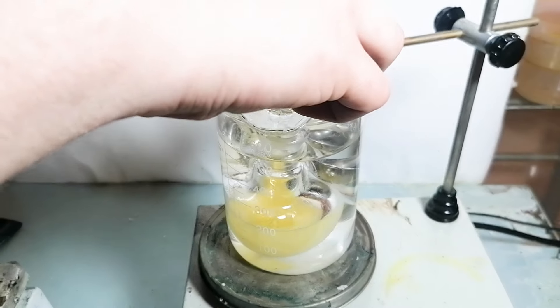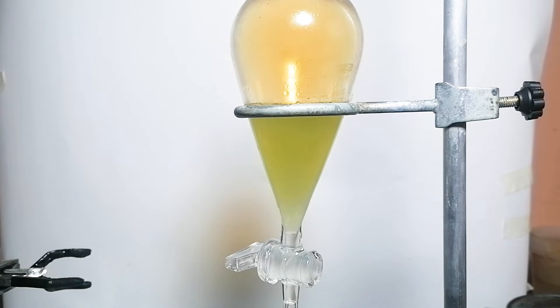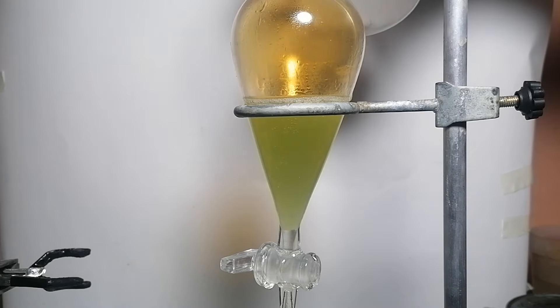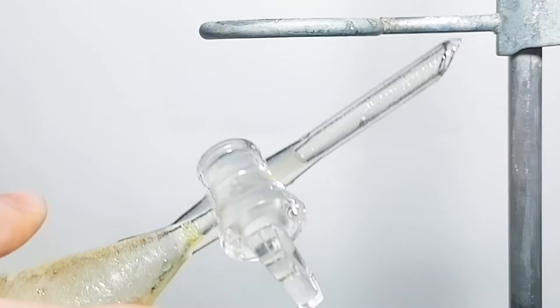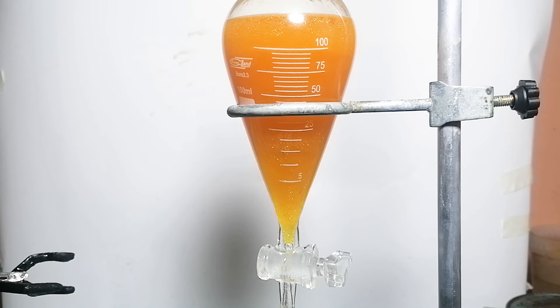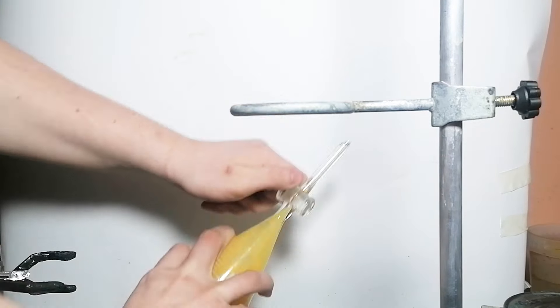I left it all to react for like 2 hours, during which I played some Fortnite. After those 2 hours, the whole thing got transferred into a separatory funnel. First I decanted the water layer, and then I did a sodium carbonate washing — this will knock out any acid left in the solution. Everything was shaken, the color changed to orange for some reason. Finally I did a saturated sodium chloride washing to wash the organic layer of any water, and everything was shaken again.